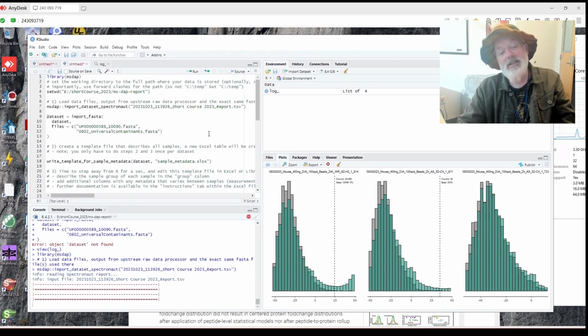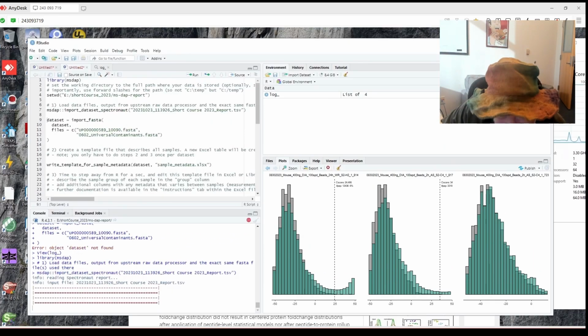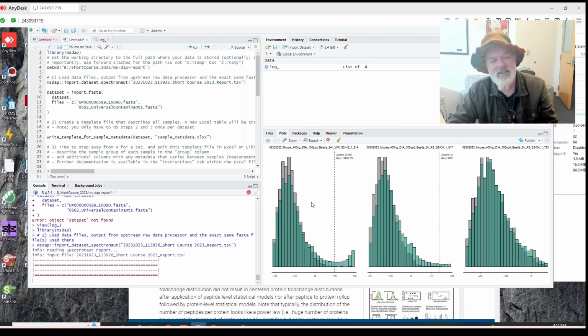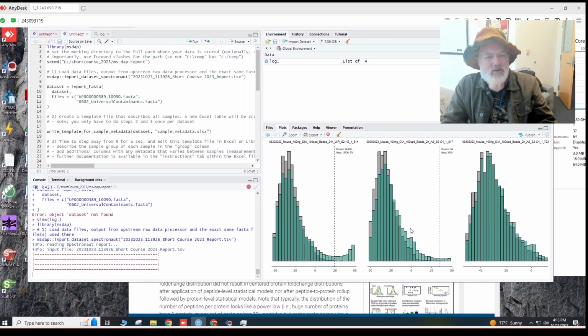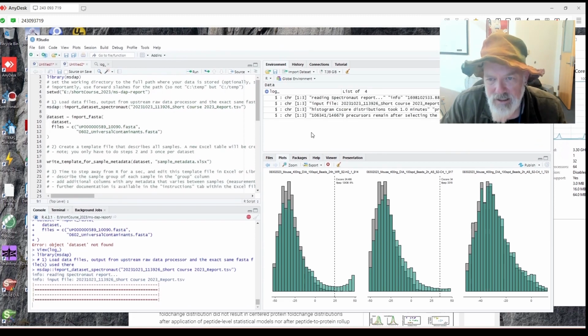So anyway, I like doing this with all the problems I have because you will probably have a lot of problems too. Well, I hope not, but I always do. So you just have to be patient. Okay, so why did I just see a log and not a dataset? I don't know.